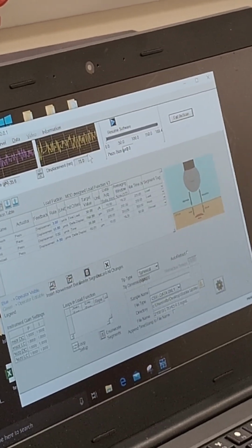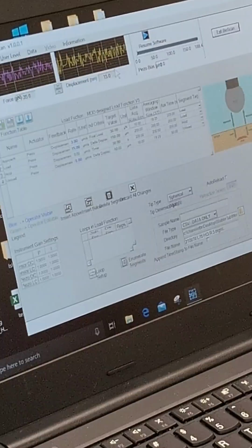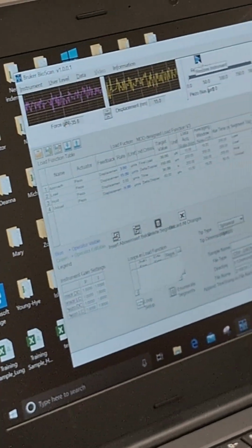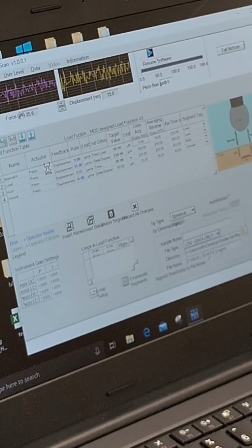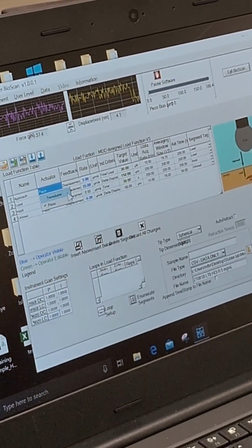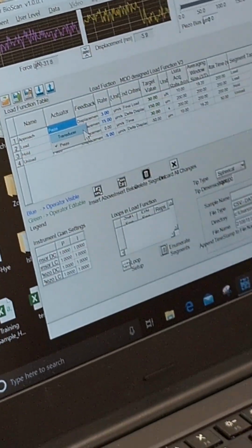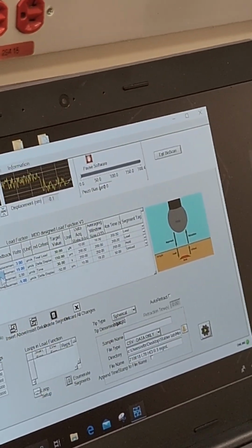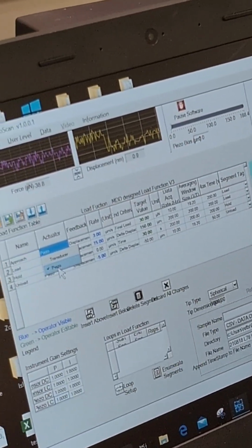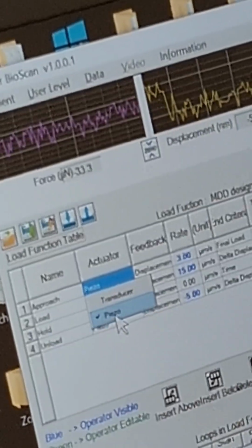Yeah. You're good. So this is sort of the principle of how that works. So you can also see that we always use piezo as an actuator. You could potentially have this changed. And there's actually another transducer, but I never use the transducer because it has a much larger range of force to be recorded. I always use piezo. So I recommend that you start with piezo until the point that you don't get good data, then you maybe switch to the transducer to see what happened there.